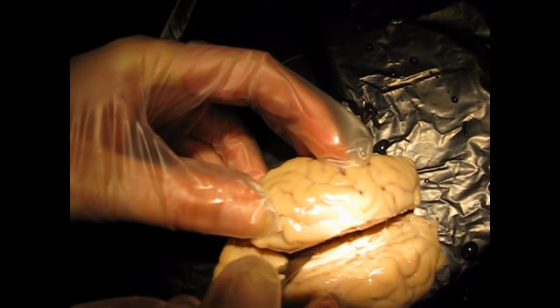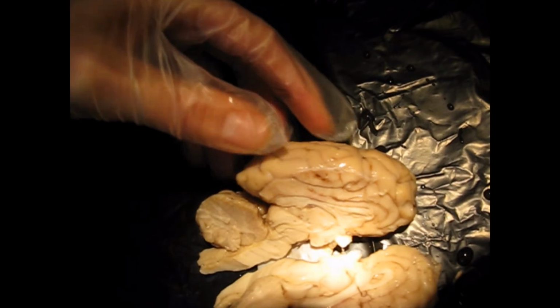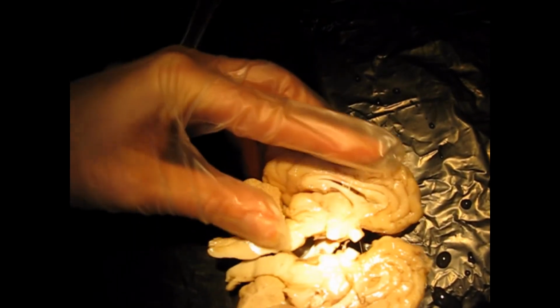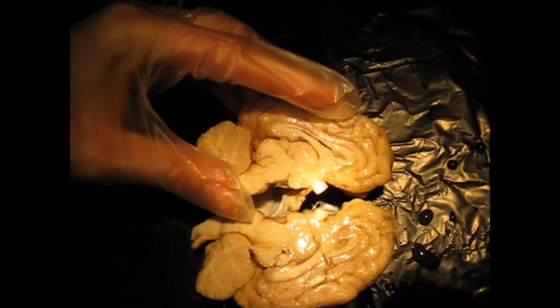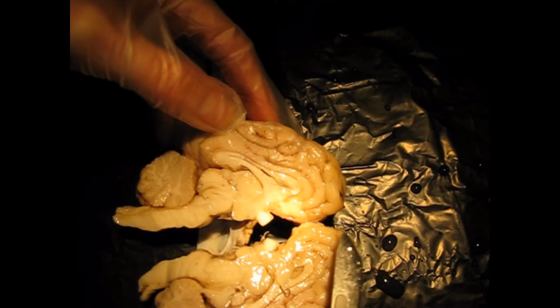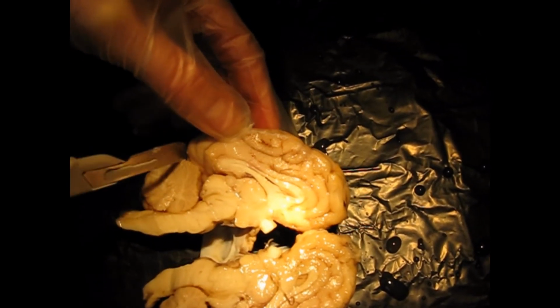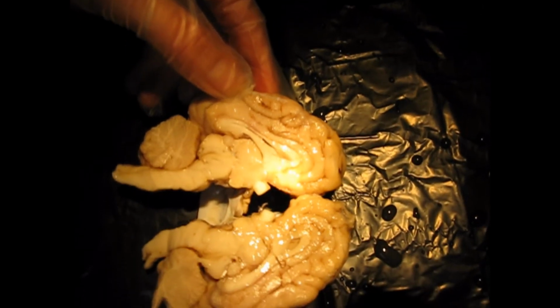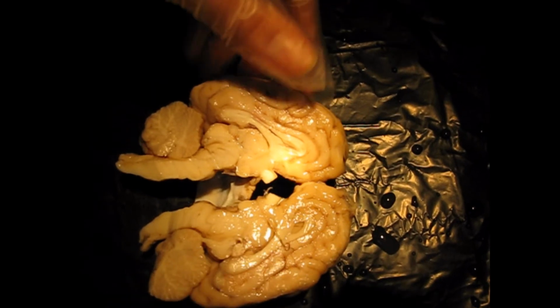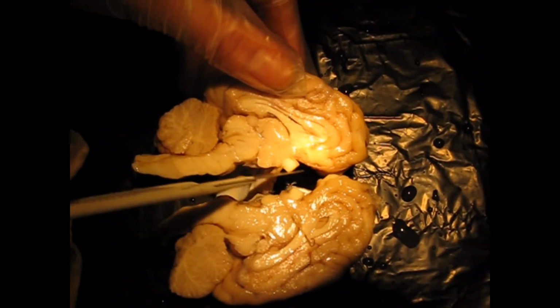Okay, go ahead and take your time. You want to go all the way through the cerebellum as well. Okay, and you will open up your brain and see structures just like this. Okay, so to get oriented again, we'll talk about the cerebrum, which again is the telencephalon. So here we have the frontal lobes, the parietal lobes, okay, and then the occipital lobes back here. Here's the cerebellum, motor coordination. All right, and then we get to get into some of the deep structures. Oh, here's your optic chiasm that we separated.